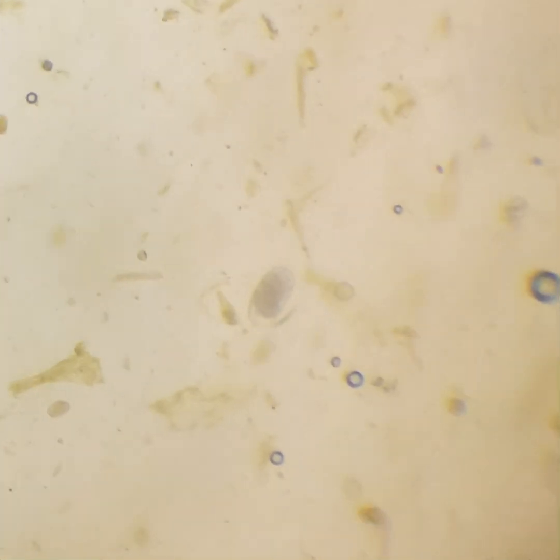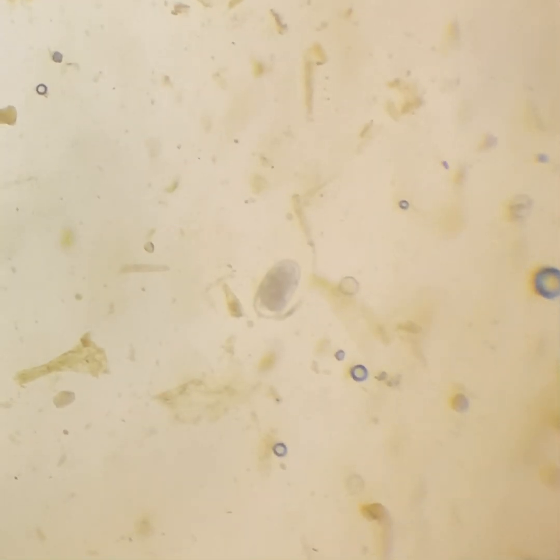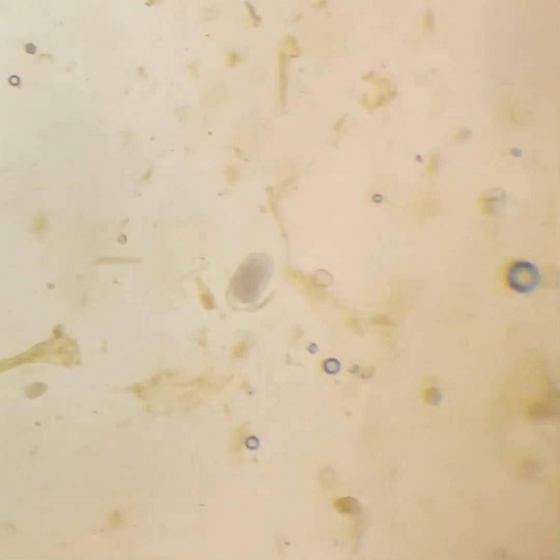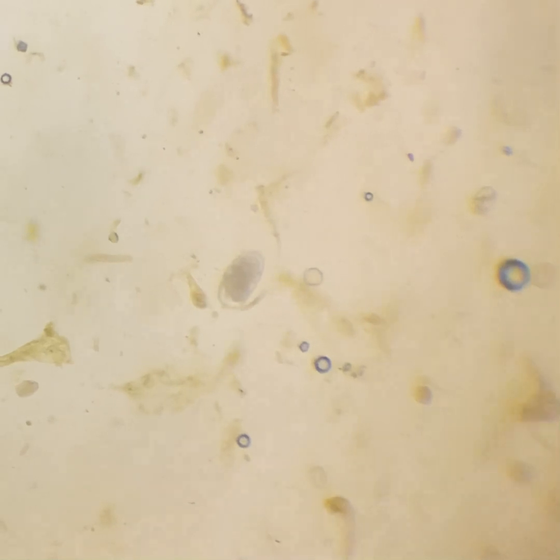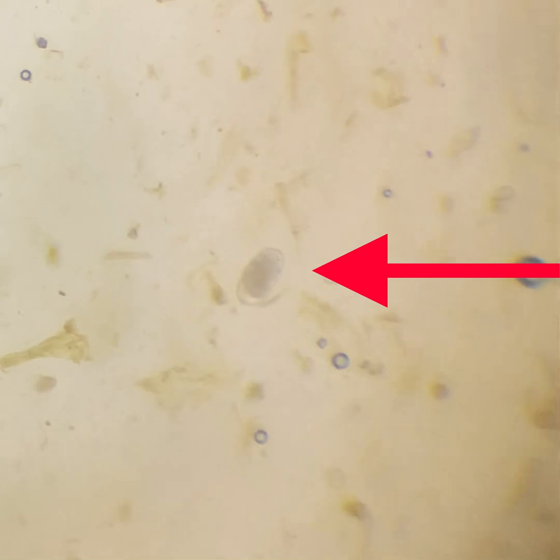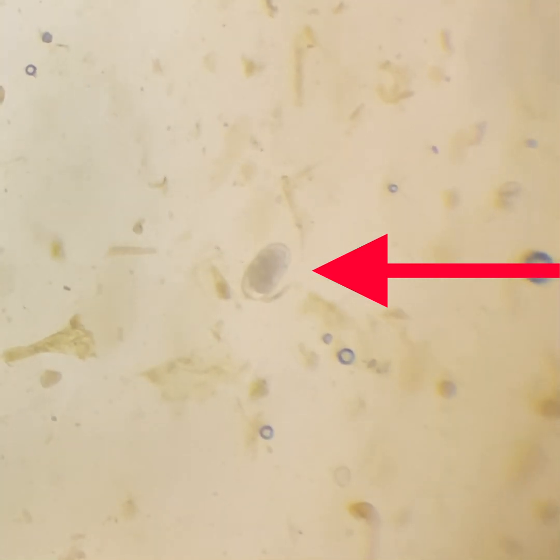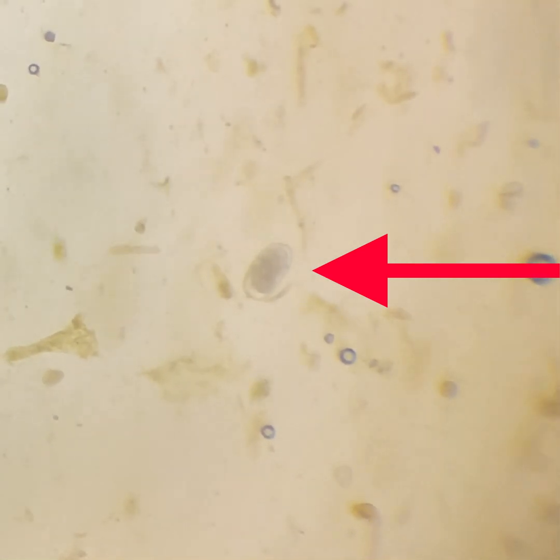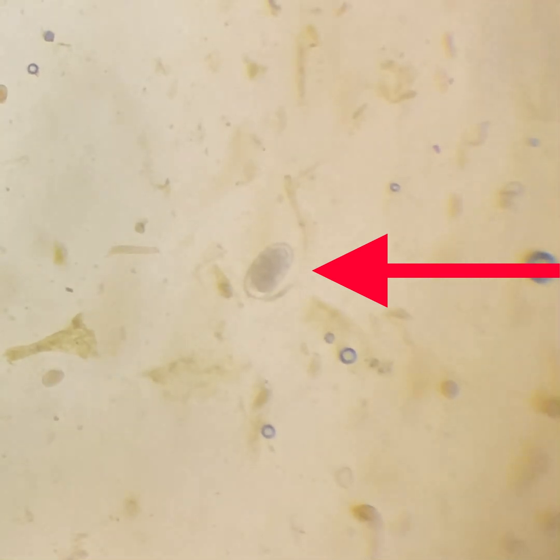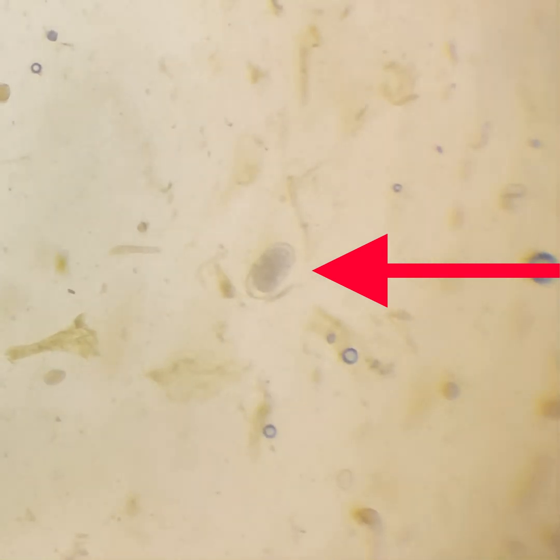We're looking here under the microscope, zooming in so you can see everything. In the center of the screen you'll see this oval-shaped structure — that's an egg. These are the strongyle eggs we're counting. We count these up and add them to create our number to give you your eggs per gram figure.